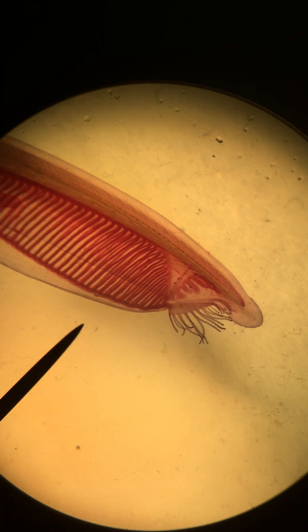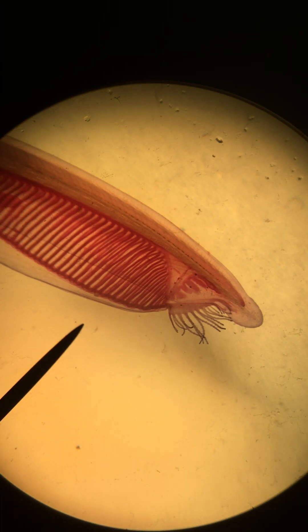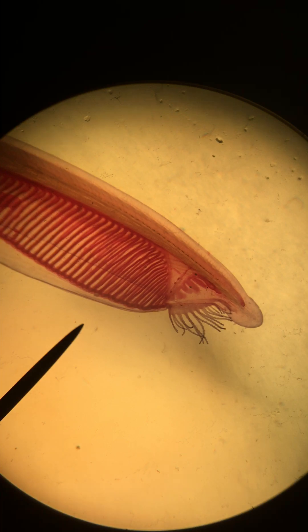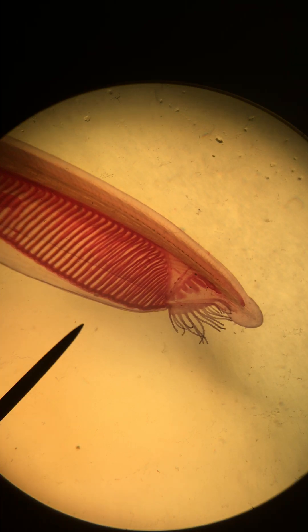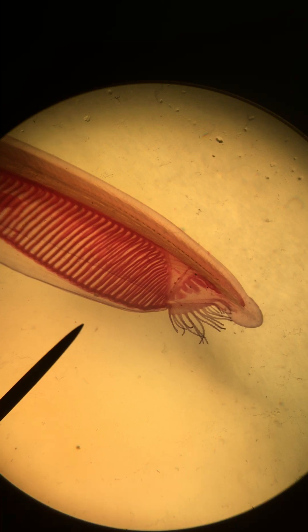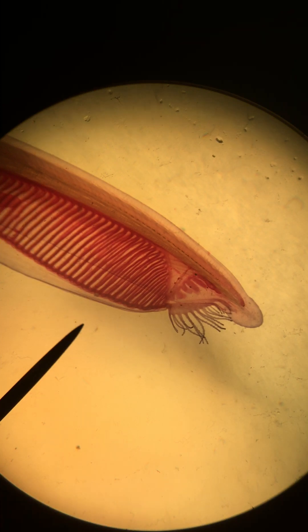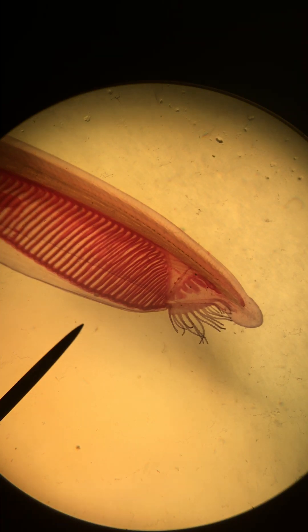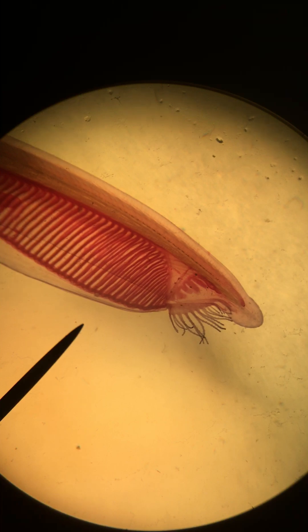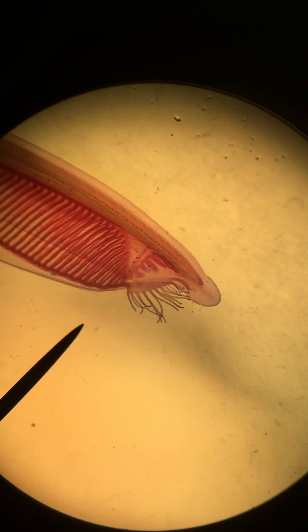Hi, GenBio. This is Dr. Frey. This slide we're looking at here is the adult lancelet or amphioxus. This particular view should look very much like figure nine in your lab manual, where we're looking at the head end of the amphioxus.